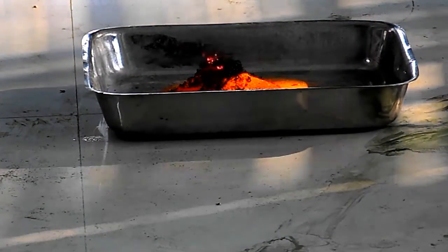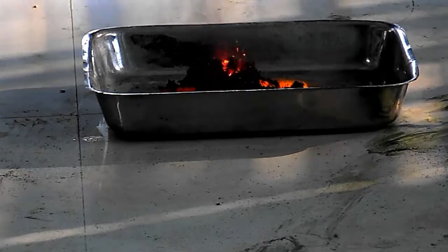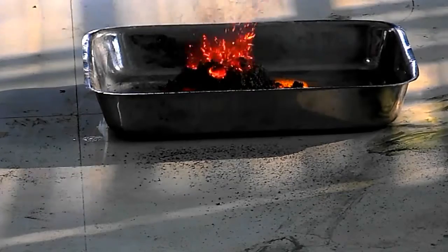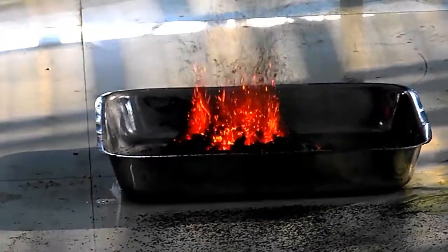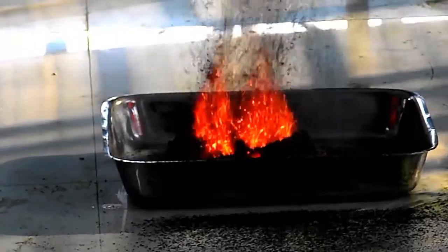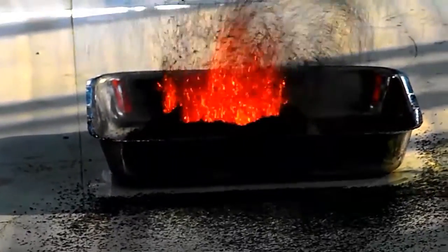As you can see, the volcano has started erupting. Now that's a lot of fly ash coming out of it.